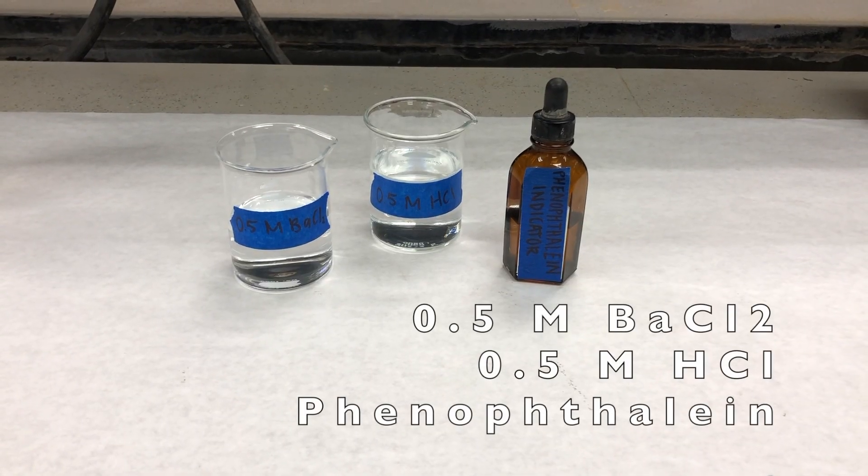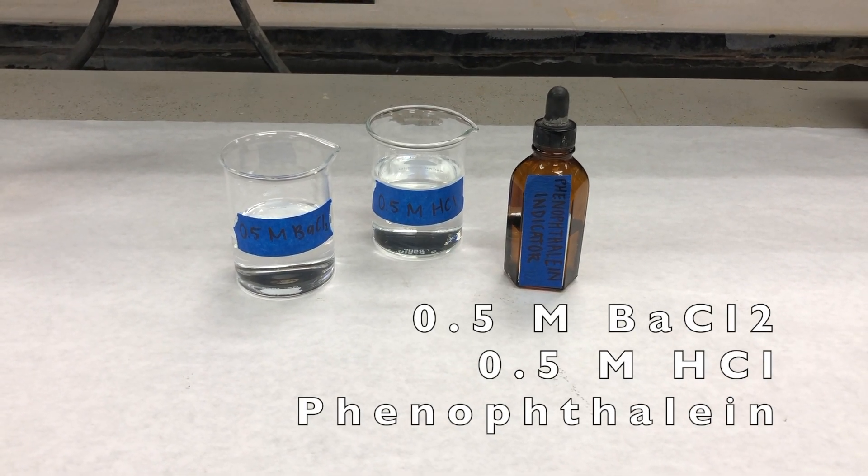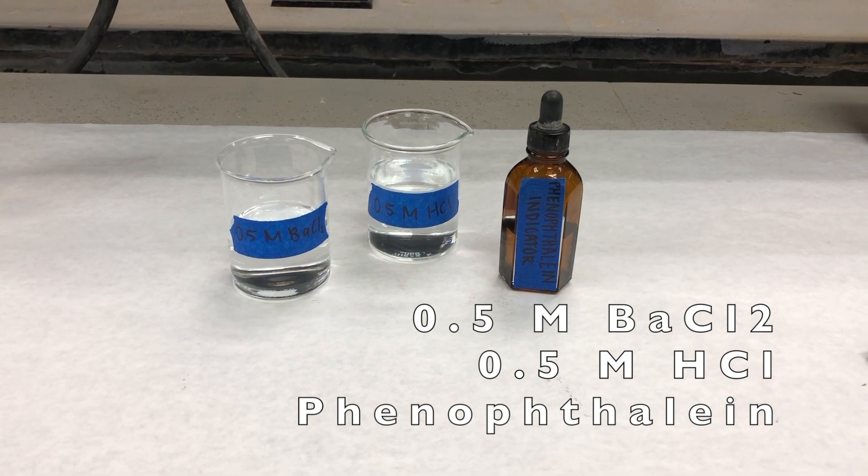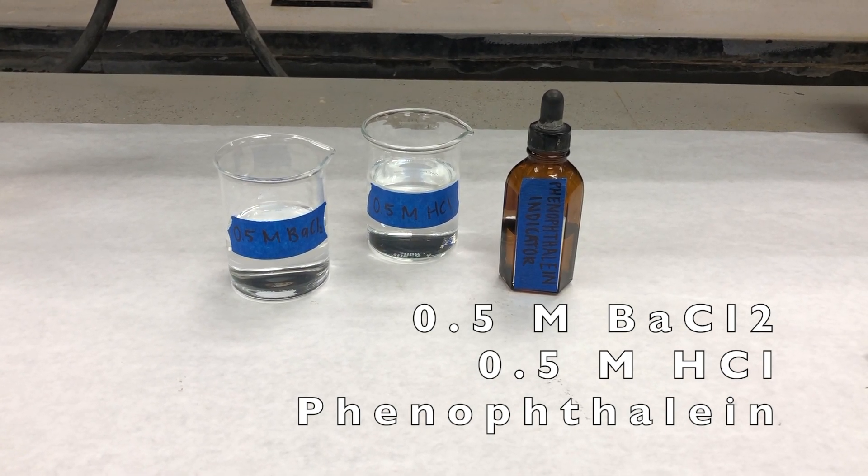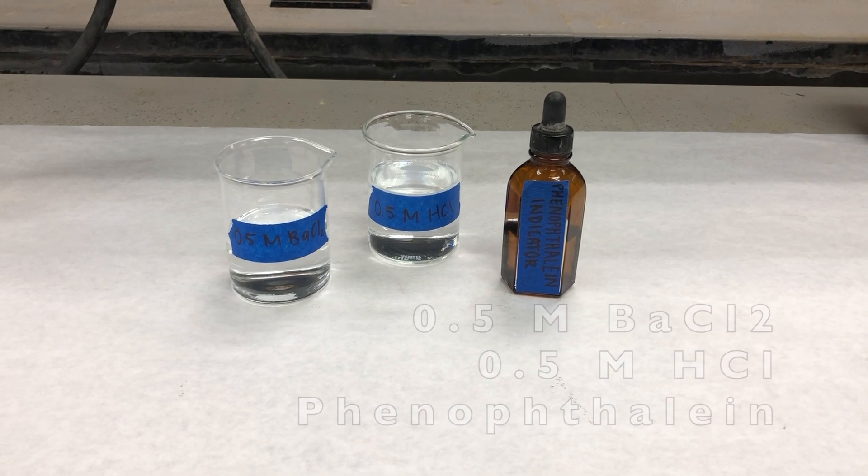In addition, you will need the following reagents: 0.5 molar barium chloride, 0.5 molar hydrochloric acid, and phenolphthalein indicator.